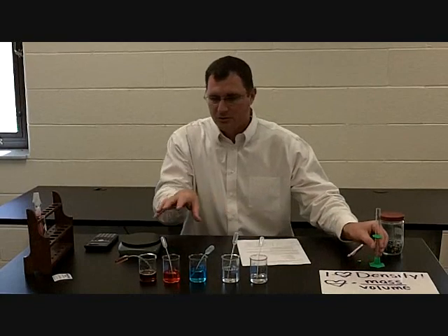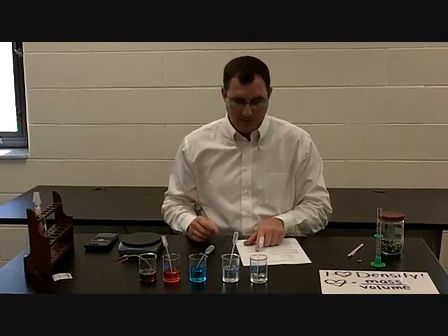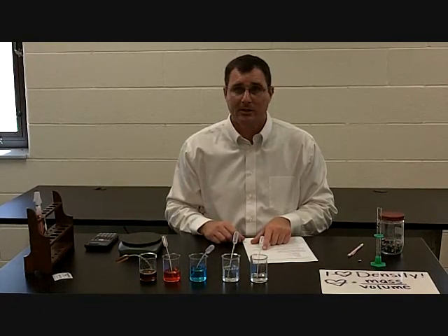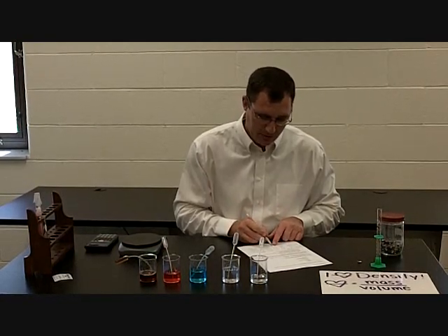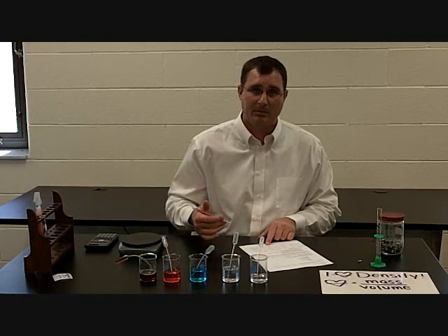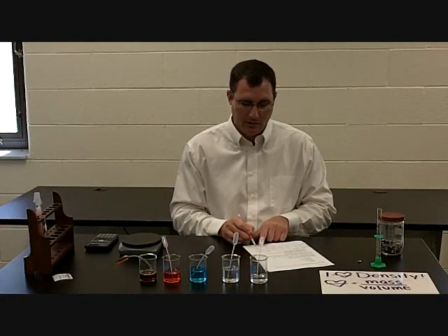Usually we tell you not to assume everything is the same, but for the sake of this lab, we're going to make the assumption that all of your pipettes weigh 0.9 grams and that they all hold 4.8 milliliters. Water was 5.7 grams with the pipette minus 0.9 grams for the pipette, leaving 4.8 grams. Since density is mass divided by volume, I take 4.8 grams divided by 4.8 milliliters, which gives me 1 gram per milliliter — exactly what we'd expect for water.